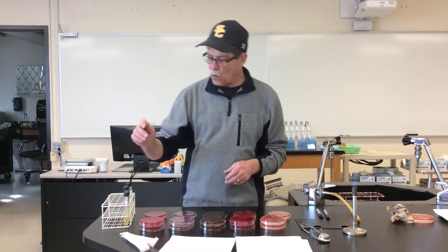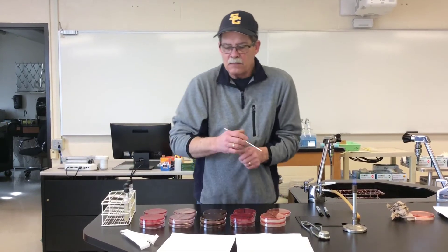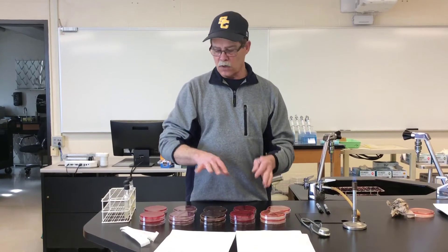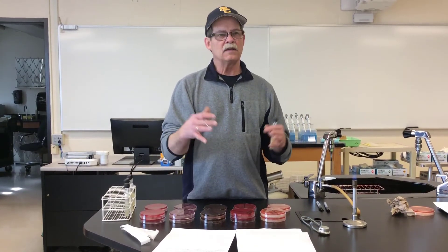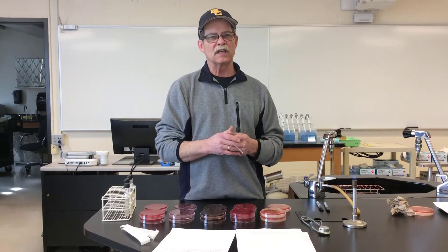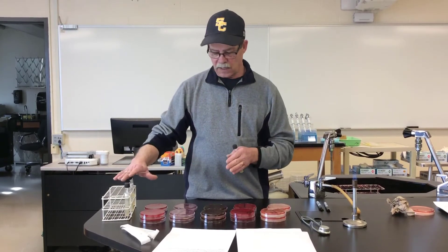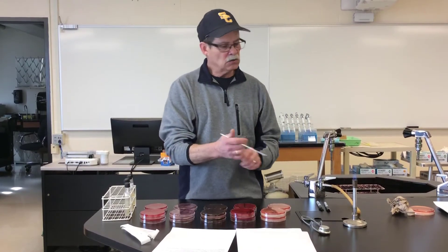I'm going to streak one organism, Staphylococcus aureus, on all of them as a demo. Then I will come back off camera and streak the rest of them. When the results are presented, we will have all six organisms on all five types of media for you to look at.